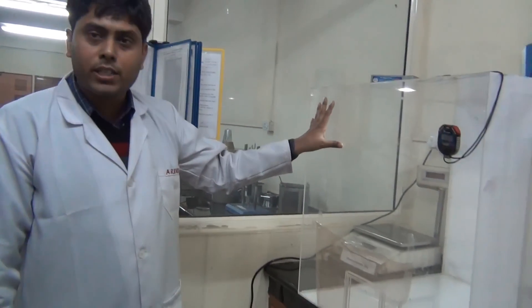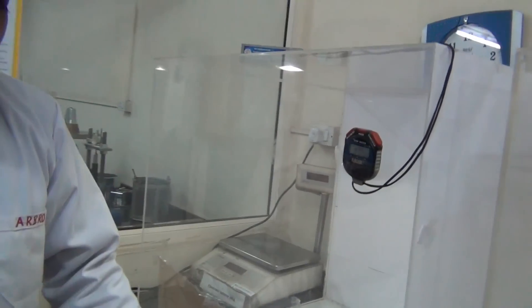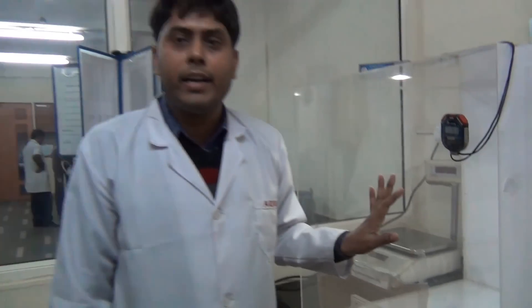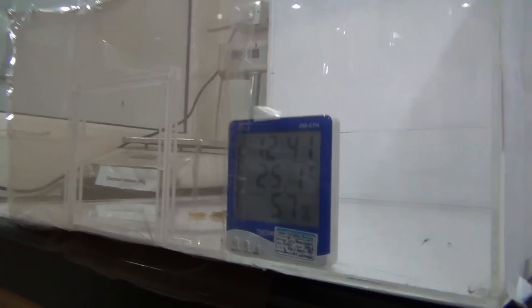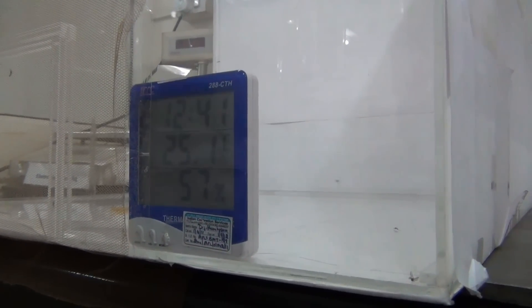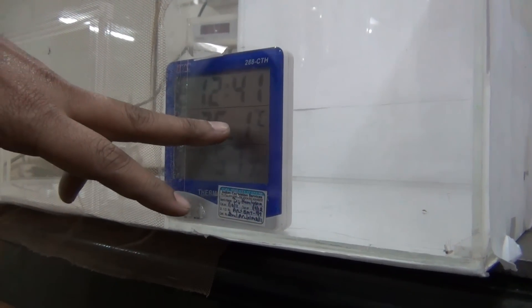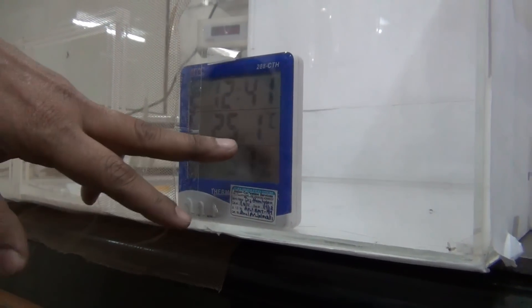I am now standing with the lab assistant. I am going to ask how to conduct a mosquito repellent test. As you can see, I have a glass chamber which has been controlled by temperature and humidity. As we have a standard, we should have a required temperature from 24 to 28 degrees, and humidity of about 55 to 75 percent. Our current control is 25.1 degrees centigrade and humidity is about 57 percent.